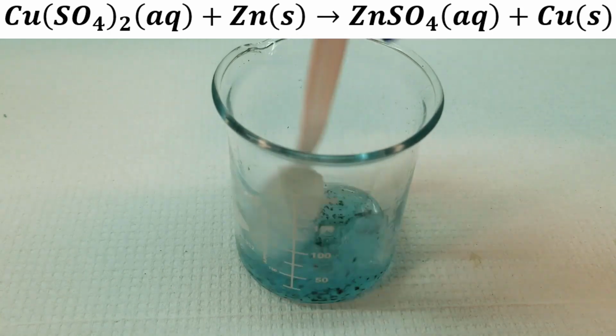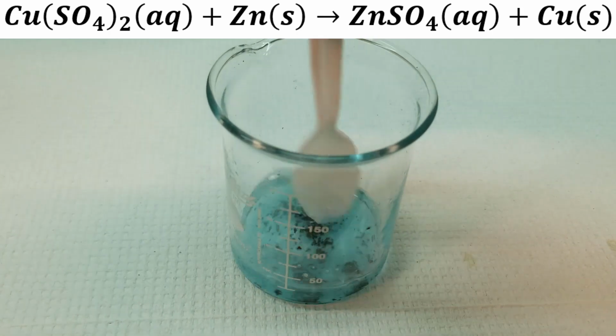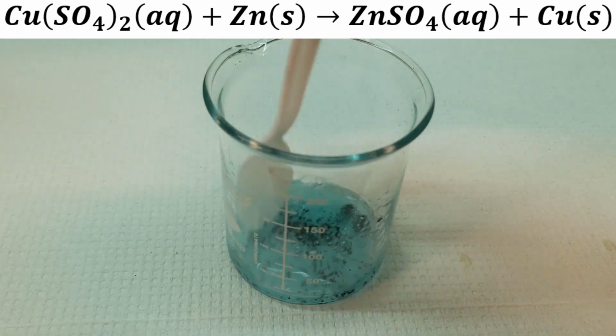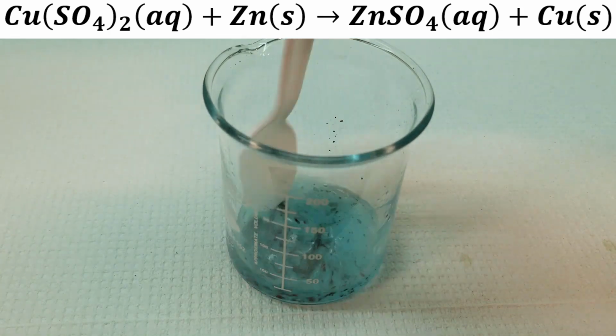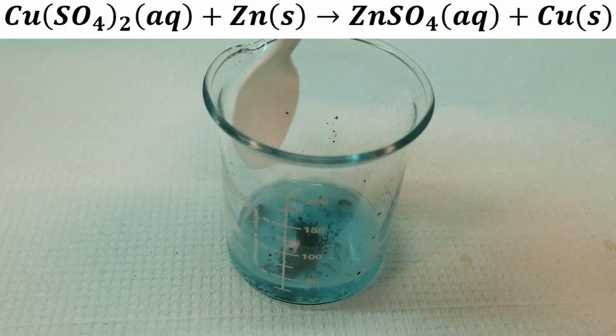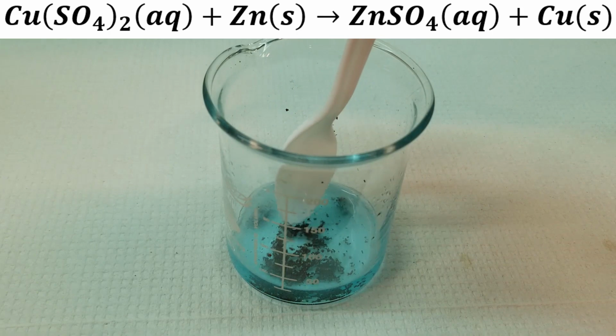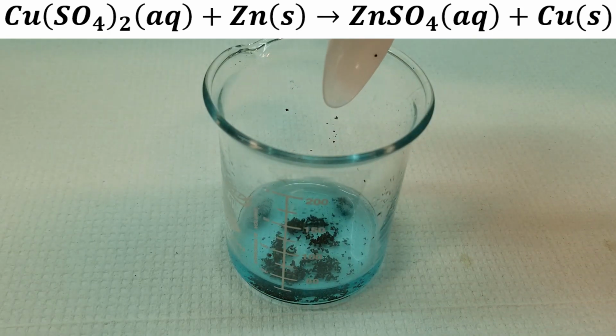And I'll stir it up more and more, and that helps the copper ions to find the zinc metal. And we're slowly but surely getting our copper metal back. You see that brown powder there? That's our copper metal.